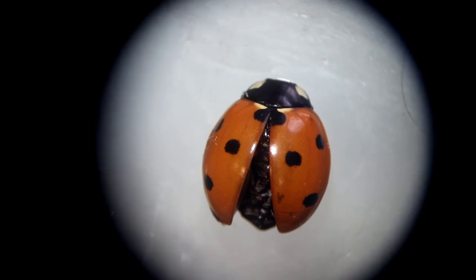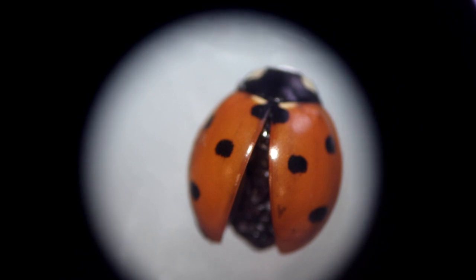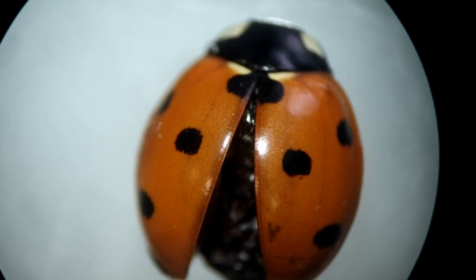Here is another picture through a stereo microscope — that was one of the better microscopes, actually. It was a zoom microscope, so by turning a knob I could continuously zoom in. Of course I lost focus this way and it was necessary to refocus. I'm holding the camera by hand so it's a little bit shaky. You can see it magnifies up to 70 times — it goes all the way from 7 times to 70 times total magnification, so it's quite impressive what you can see here.